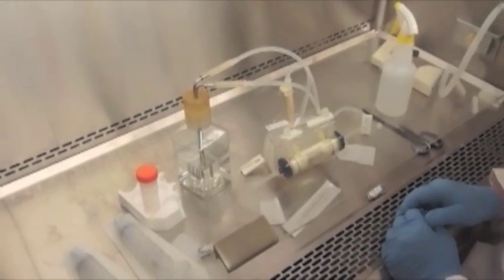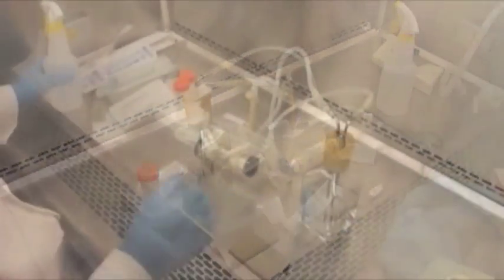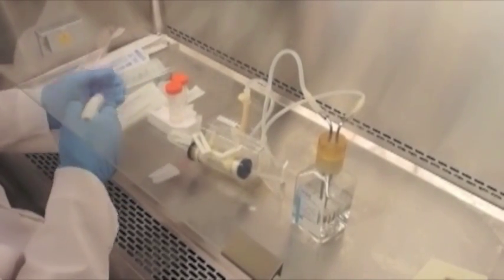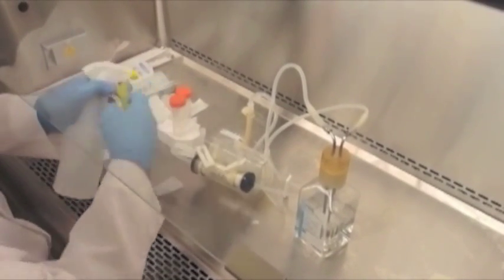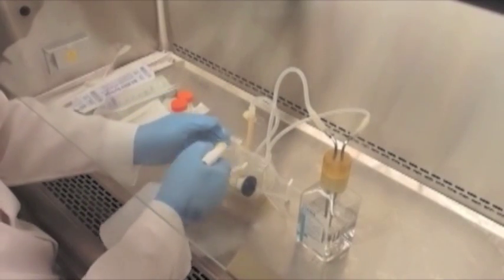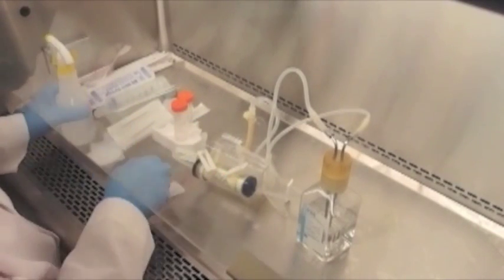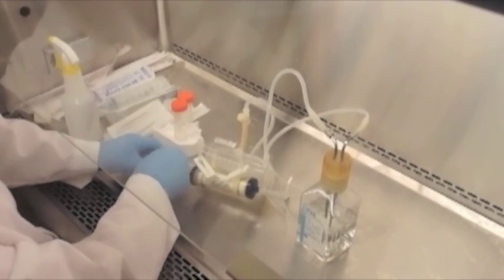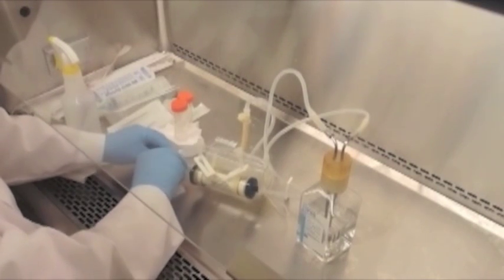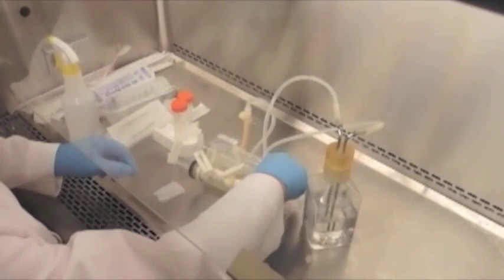However, now we need to fill the extracapillary space with PBS. This is where the 50 ml conical that we filled before with PBS comes into play. We want to close the left end port slide clamp and then the right end port slide clamp.